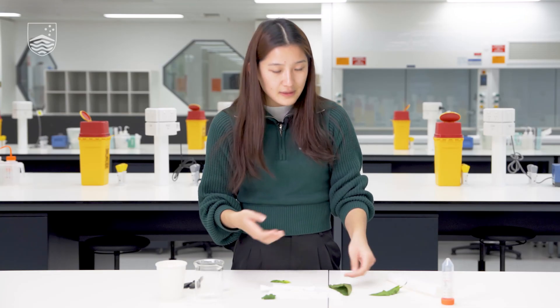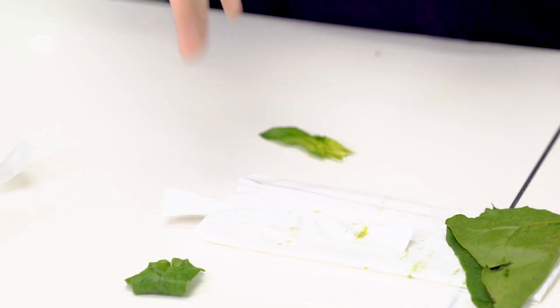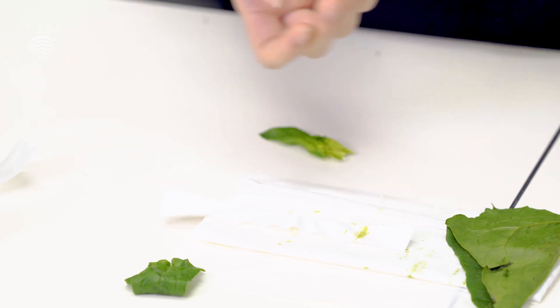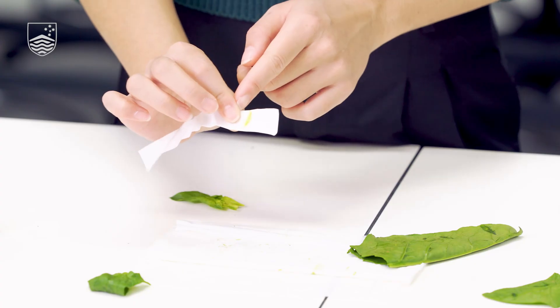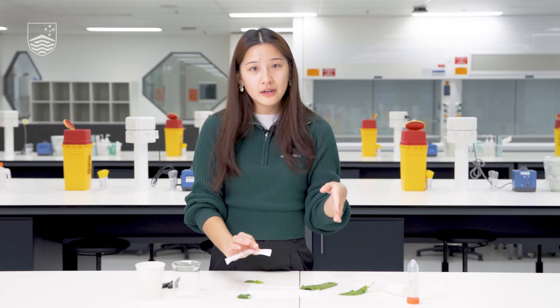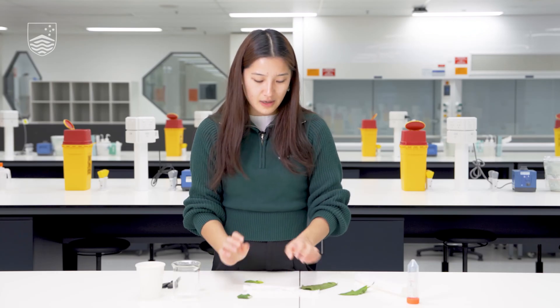You can repeat this a few more times depending on your patience, but you do want to get a quite solid green line forming for the best effects. Make sure the green line is about two or three centimeters away from the bottom of your paper — not right on the edge, a couple of centimeters in is perfect.